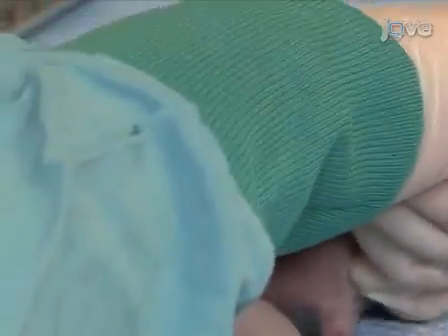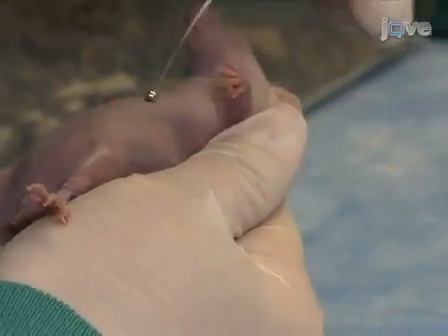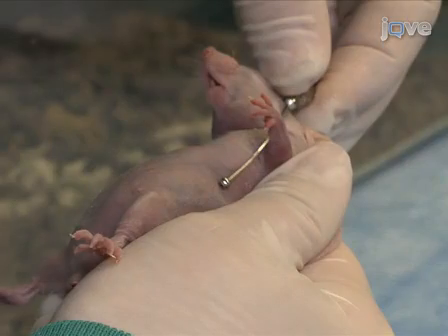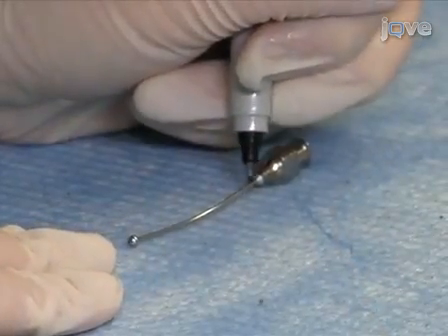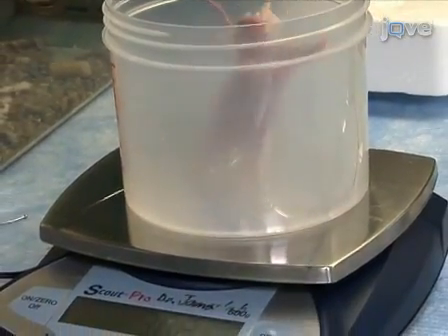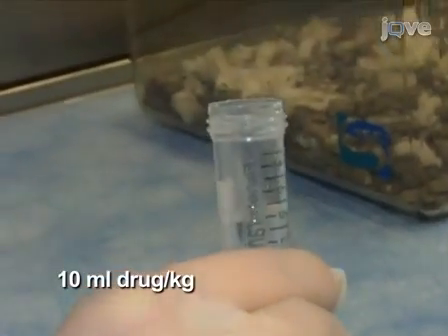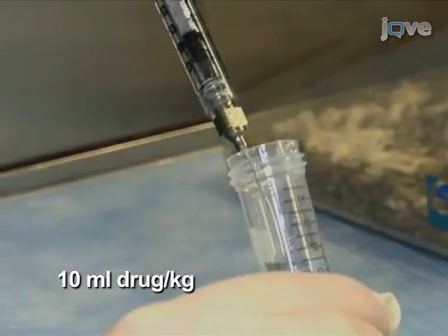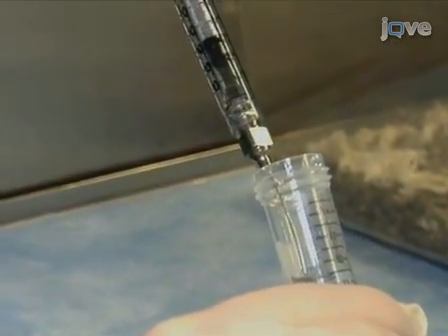Begin oral gavage by determining how far the needle can be inserted into the mouth of the mouse. Hold an 18G ball-tip curved gavage needle at the last rib. Mark the length using a permanent marker. Weigh the mouse to determine the injection volume. The maximum volume that can be delivered by oral gavage is 10 milliliters per kilogram of body weight. Then, load the needle.